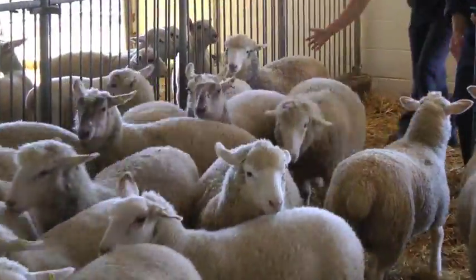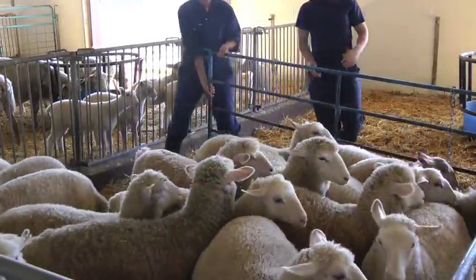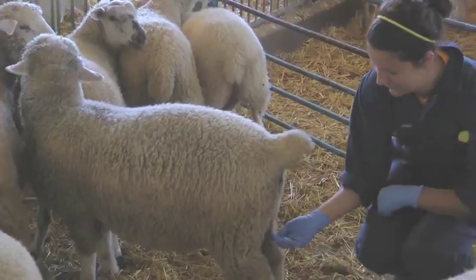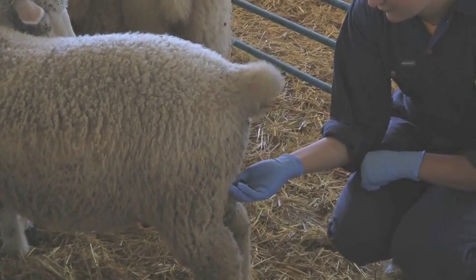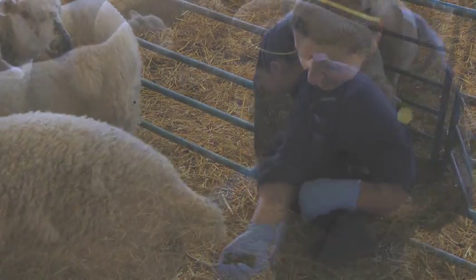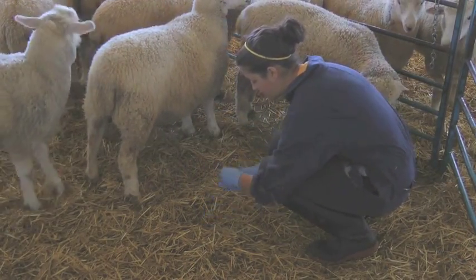There are two methods for collecting fecal samples. The first and easiest method is to confine your sheep to a small area and observe them while they defecate. If you're fast enough, you can catch the fecal samples. Otherwise, you can retrieve them from the ground. Just make sure you're not picking up other debris such as straw, as this will contaminate the sample.